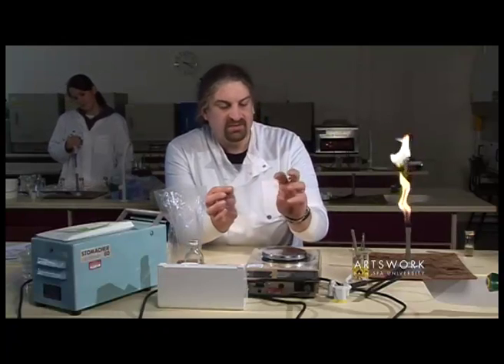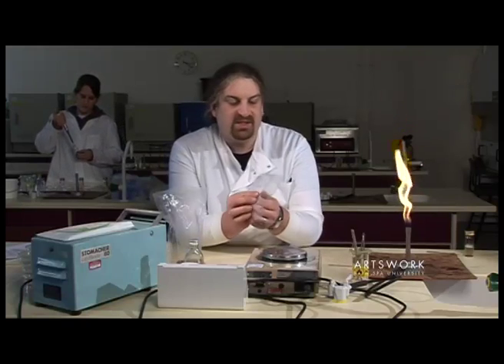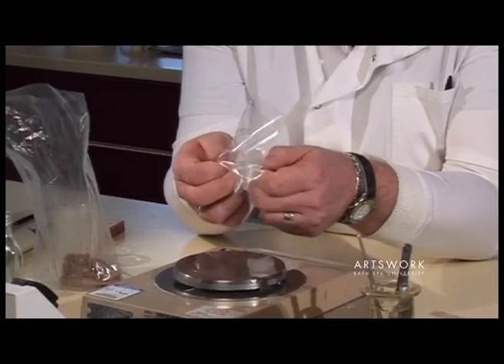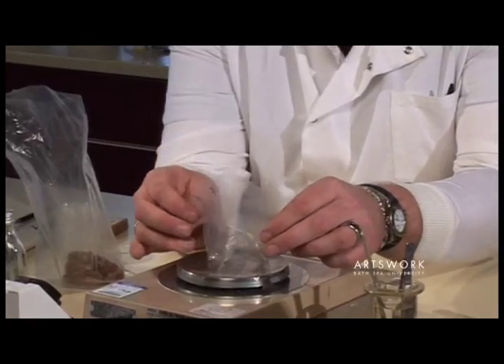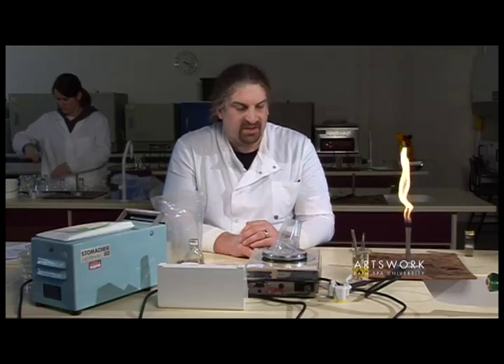We need to open this bag and stand it on the balance so we can add our sample. The easiest way to do that is to take both sides of the bag and just open out the base, fold the base in so it sits nicely on top of the balance, so you can then add your sample and the liquid.